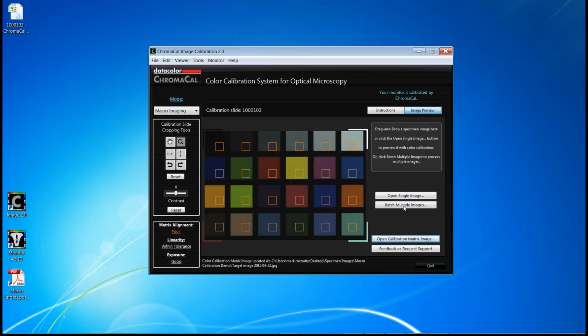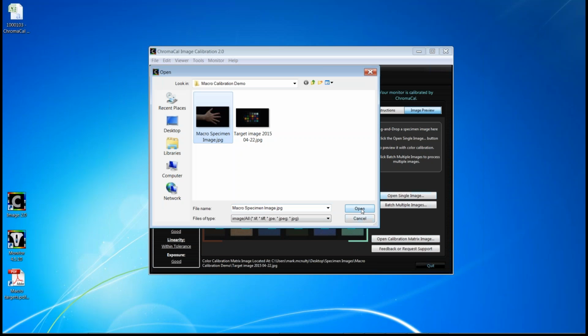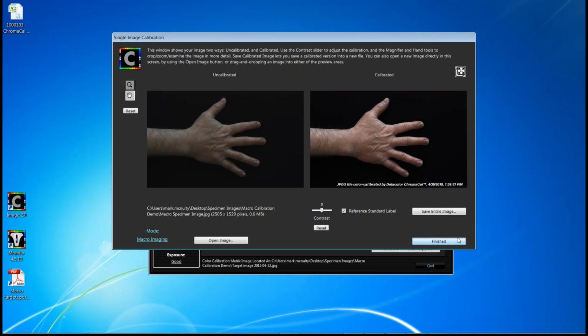You align it. At this point, I need to make a few adjustments, and then you open a macroscopic image. Right away, it's calibrated, so the same flow, the same workflow, the same features all exist for macroscopic imaging. It's just the target that is different.